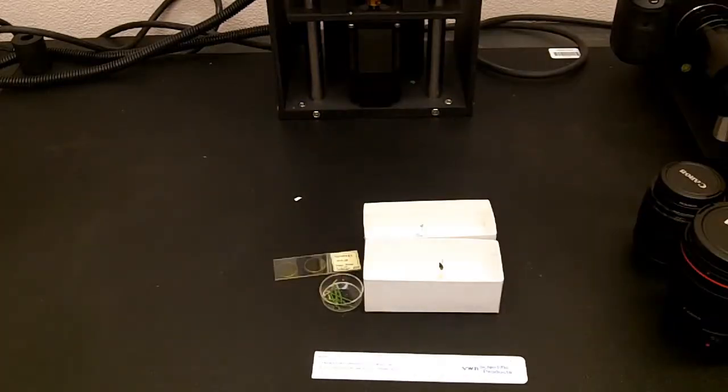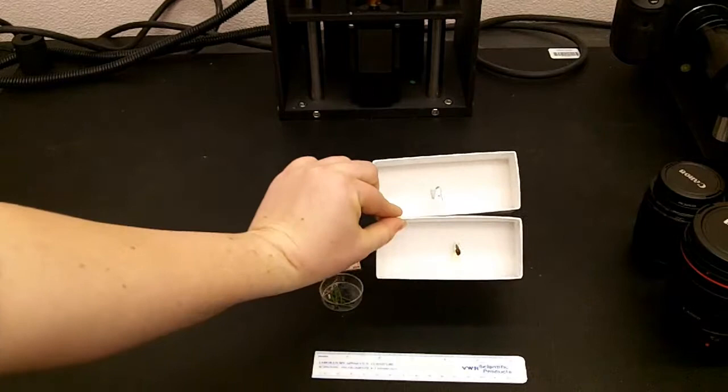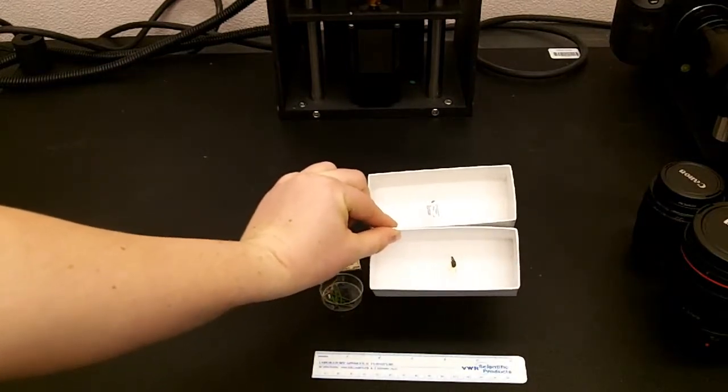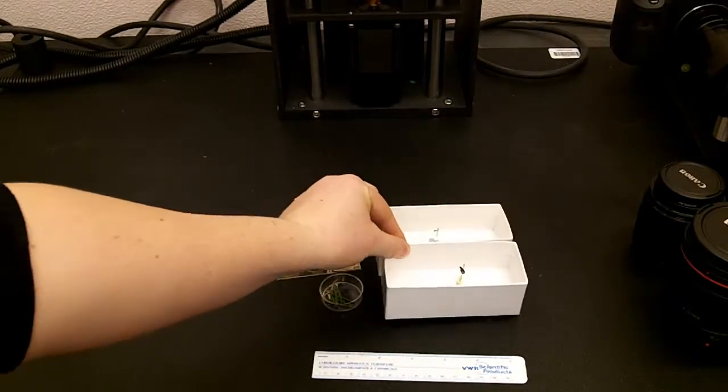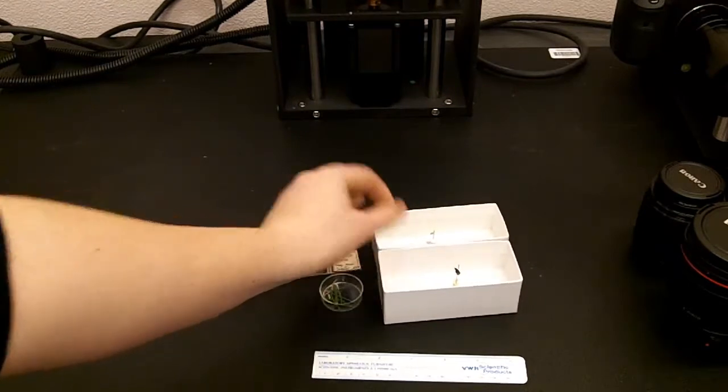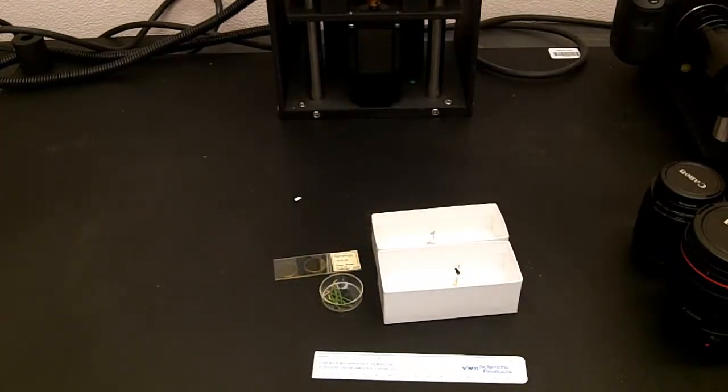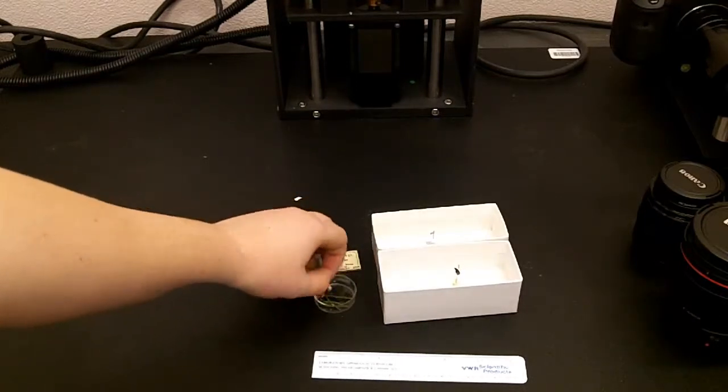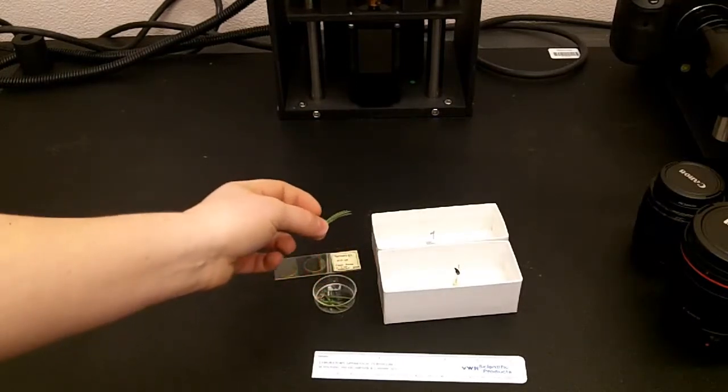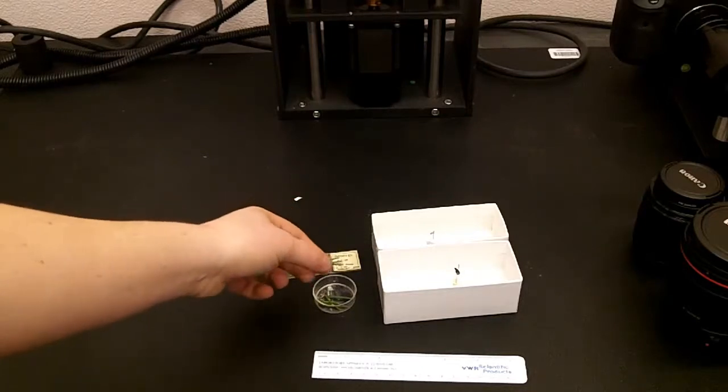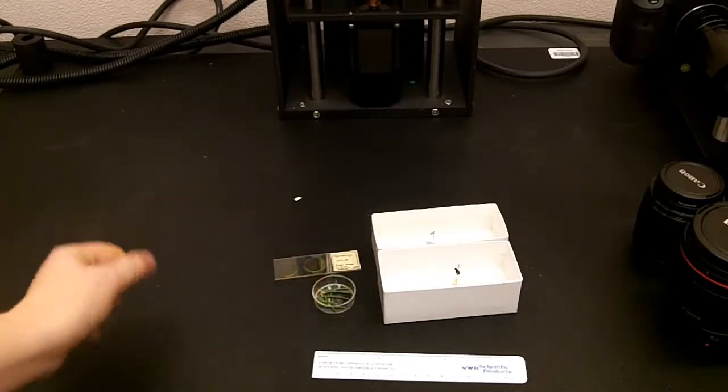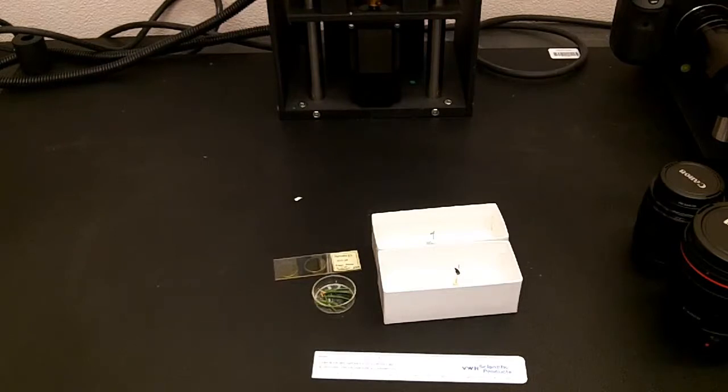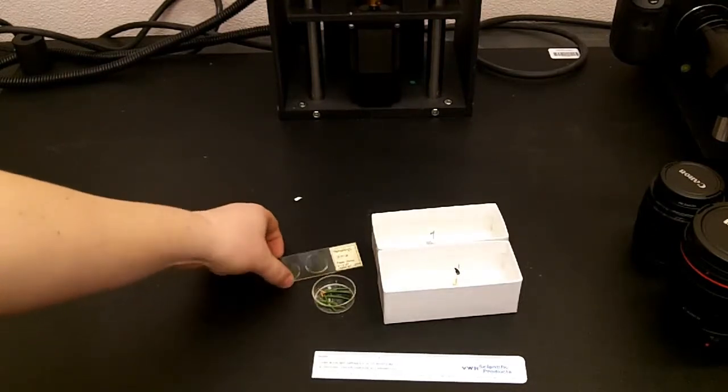So, here are some very small specimens. Some very small insects between a centimeter and several millimeters in length. And these would be good to be imaged using the 65mm. And here we have some conifer needles that, using the 65mm, you can zoom in quite a lot and get a lot of detail of individual cells on the needles.